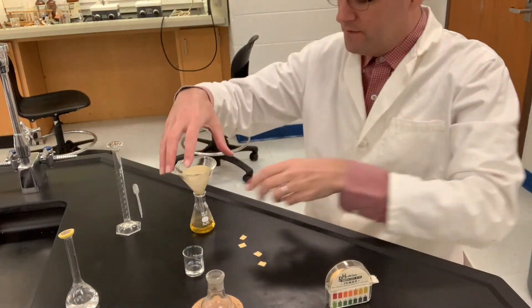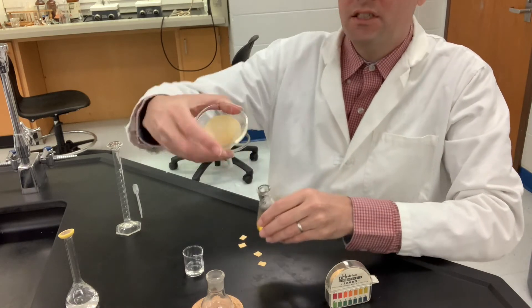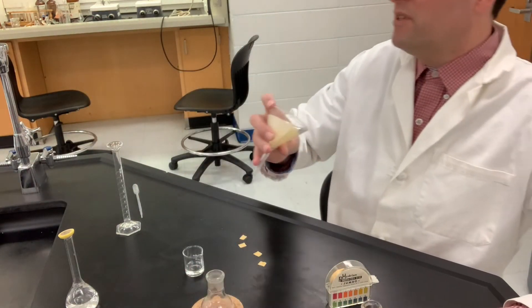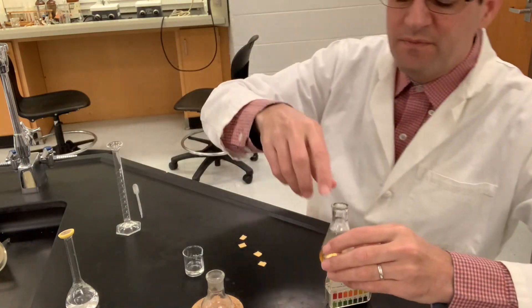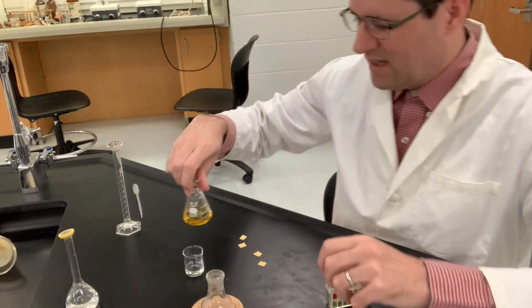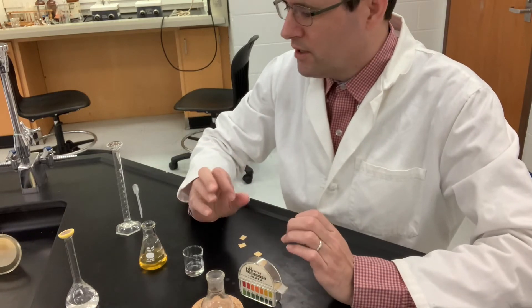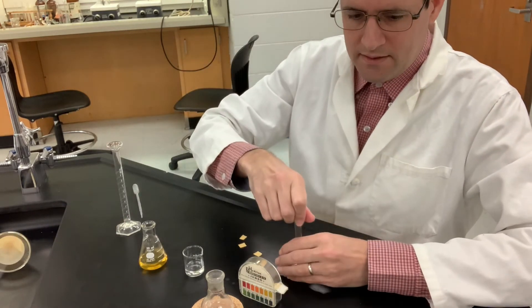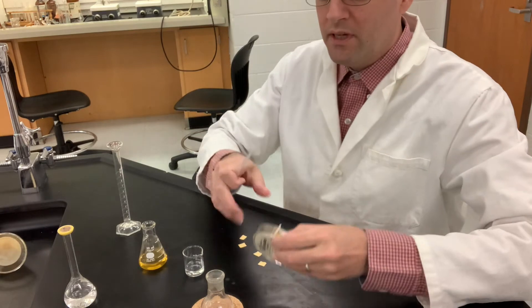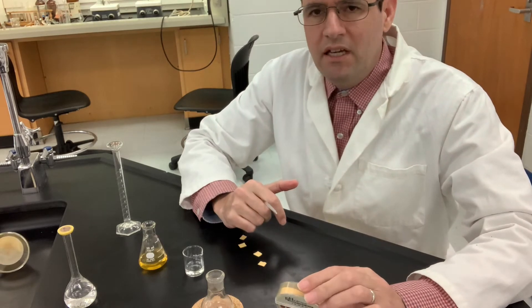We finished filtering any insoluble solids left in our reaction mixture and washed the funnel. There's really hard to see - there might be a tad bit of solid dispersed on the filter paper - and we have a nice clear homogeneous solution that's not cloudy anymore. The procedure now says to add about 4.5 milliliters of two molar hydrochloric acid. I have three molar hydrochloric acid which will require three milliliters approximately.